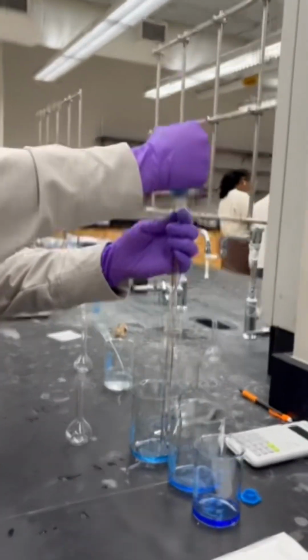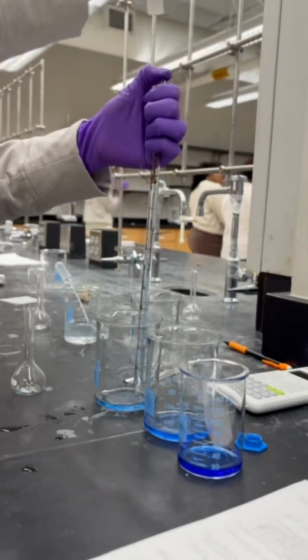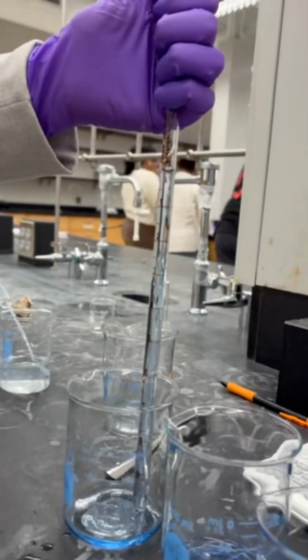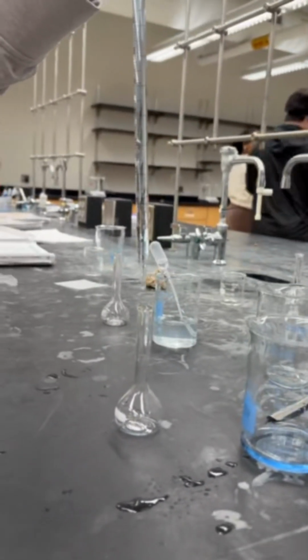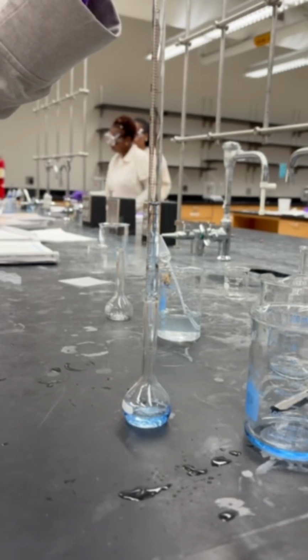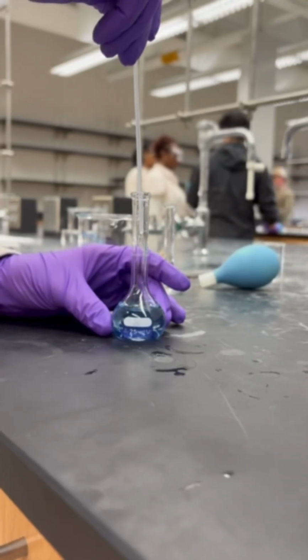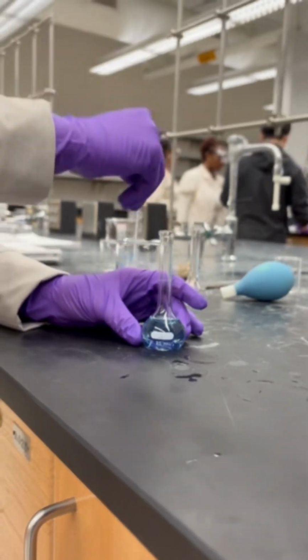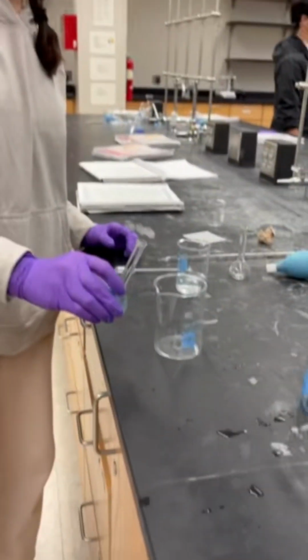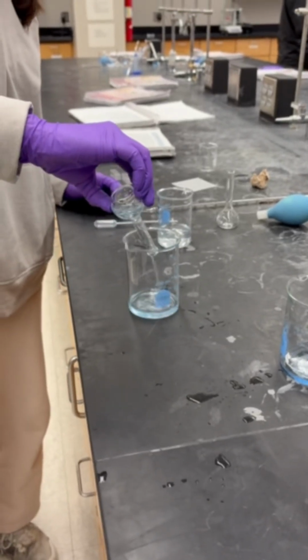We then begin our third dilution. Now, the reason why we are making three dilutions is more important to the second half of this experiment, which will not be shown in this video. But we will be sending these solutions through a spectrophotometer, which will read the absorbance of light through these liquids. Now, the absorbance is directly proportional to the concentration of your dilutions.